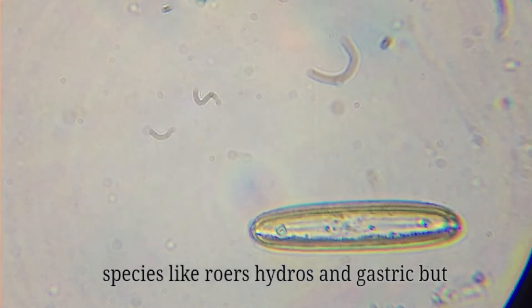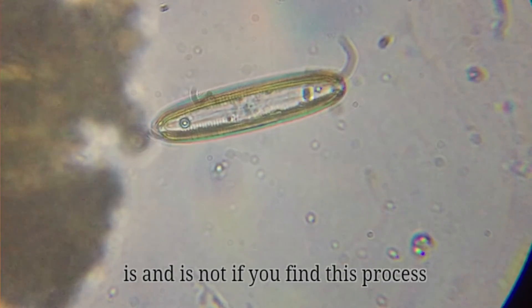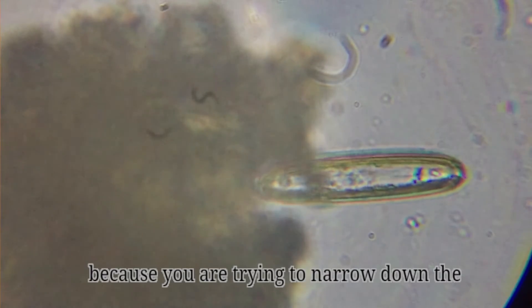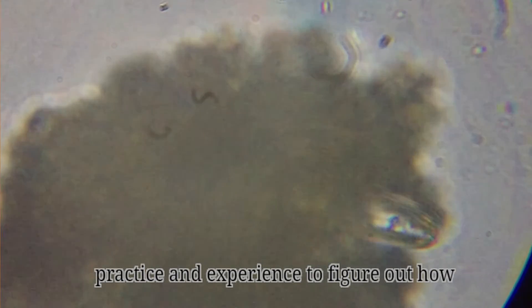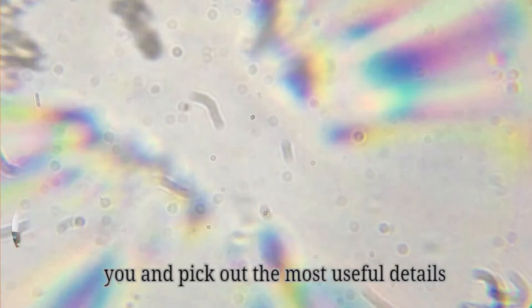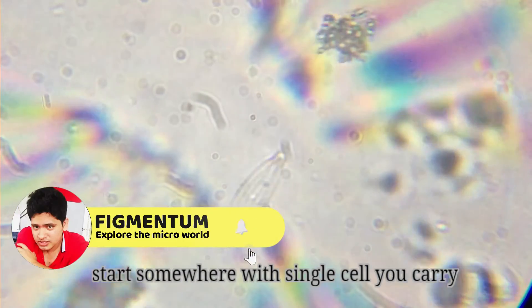A search like that can bring up a whole range of species — like rotifers, hydras, and gastrotrichs — but each of those animals is very different from the others, which can help narrow down what your unidentified organism is and is not. If you find this process overwhelming at first, because you are trying to narrow down the vastness of the microcosmos to just one species, that's okay. Every time you do this you will get better at it. It takes years of practice and experience to pick out the most useful details — and like a baby tardigrade waving its legs for the first time, we all have to start somewhere.